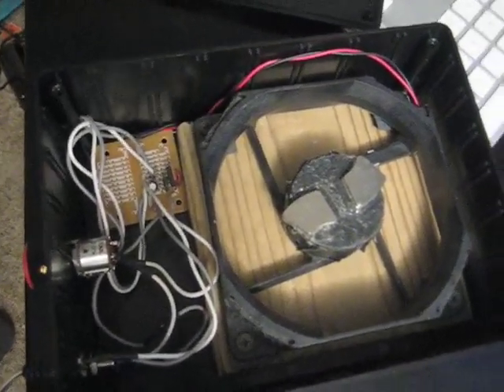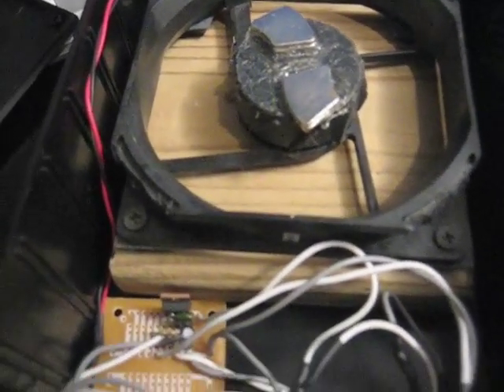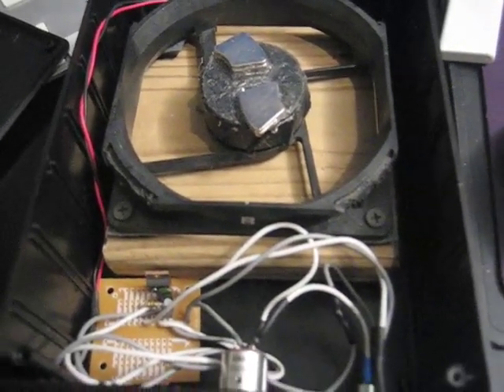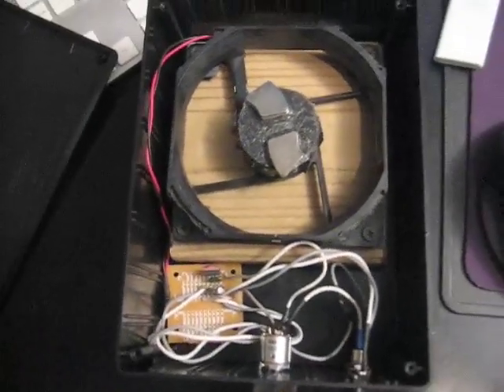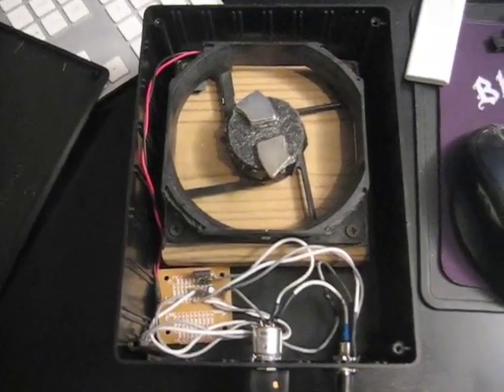This is pretty simple to make. I've mounted my fan on a block of wood so I can easily take it out and change the height. I'm probably going to put a mouse pad or two underneath it to reduce any noise or vibration so it runs silently when it's actually operating for 24 to 48 hours in a row.